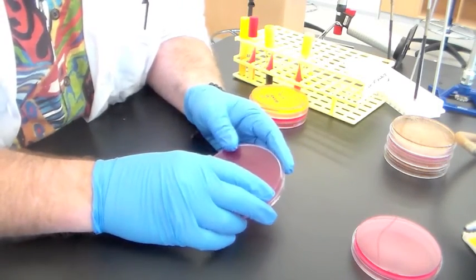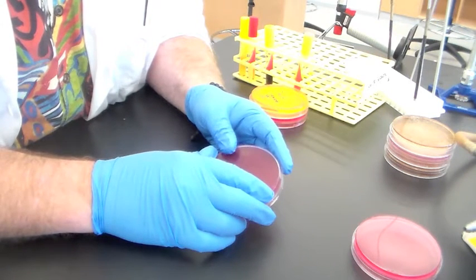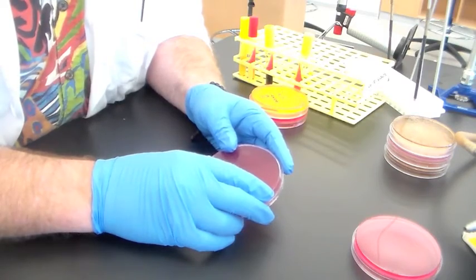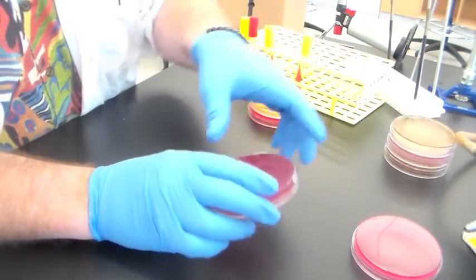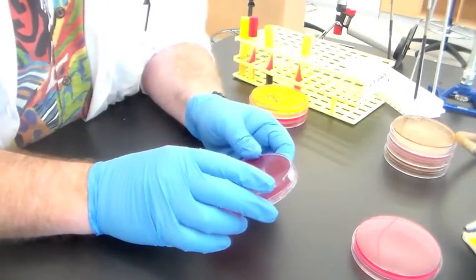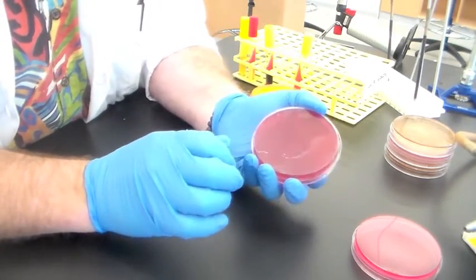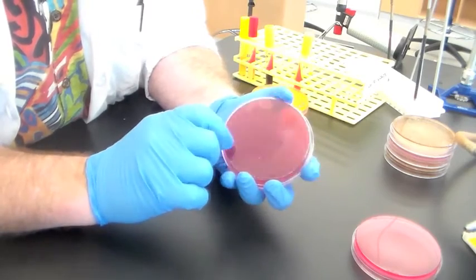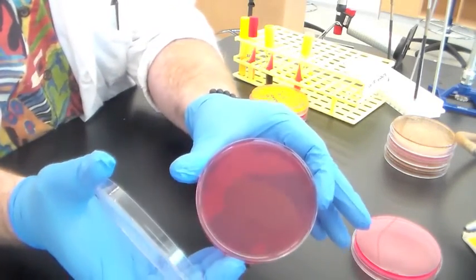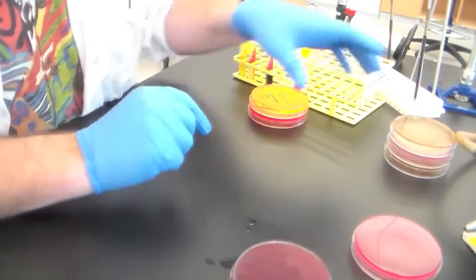Another, and I think better, type of differential and selective media — which is also very important for your unknown quest — is MacConkey agar. You inoculated several different species onto plates of MacConkey, this pretty pink agar. This is the way it looks before you inoculated it.